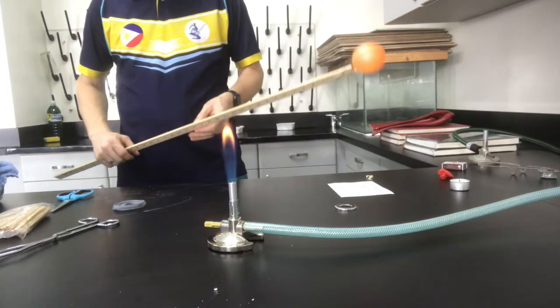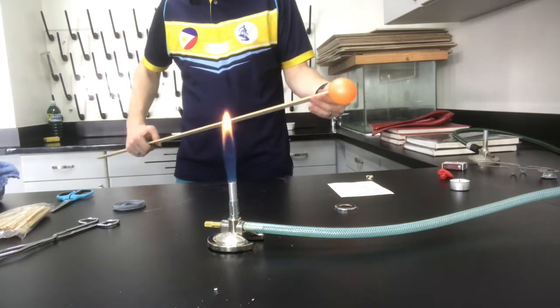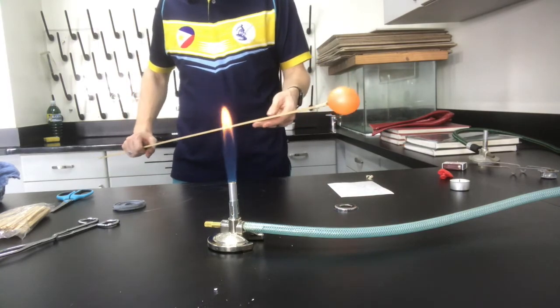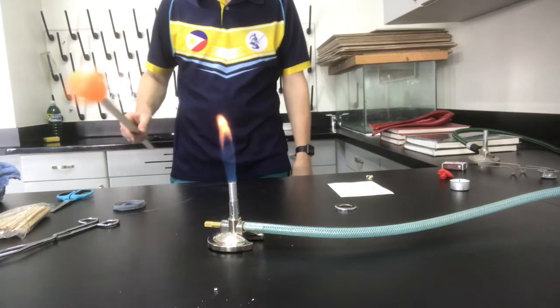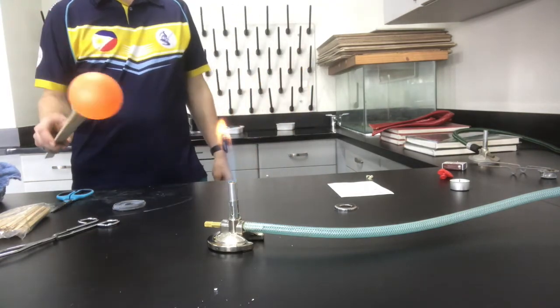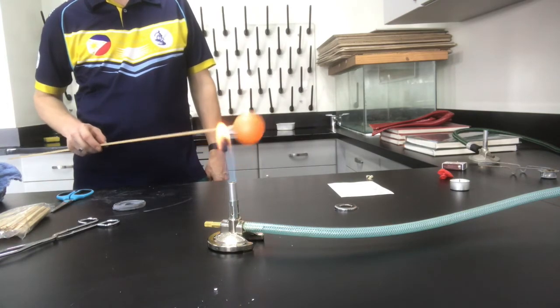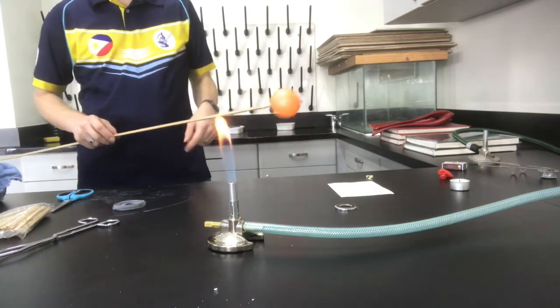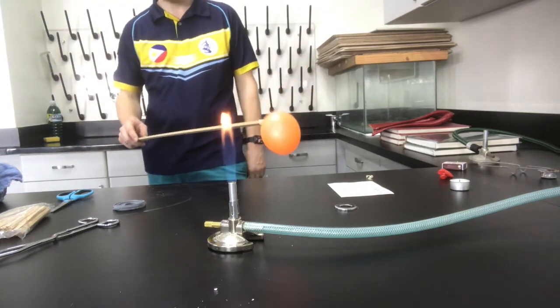Hey guys, welcome to round 2. When I finished filming round 1, I realised that the camera angle wasn't the best, so this time less of my face, more of hopefully the explosion. So again, hydrogen in the balloon. We've got a heat source to get the combustion going in our Bunsen burner, and then oxygen in the atmosphere. So let's try this again.